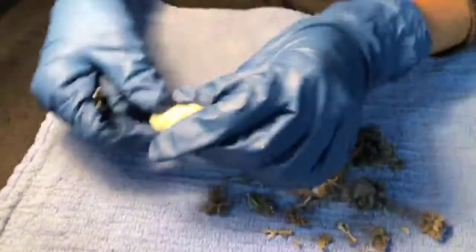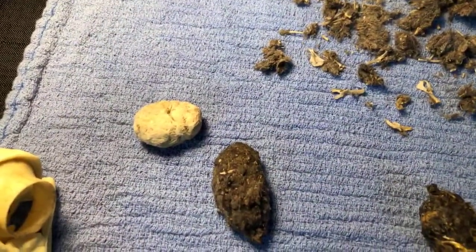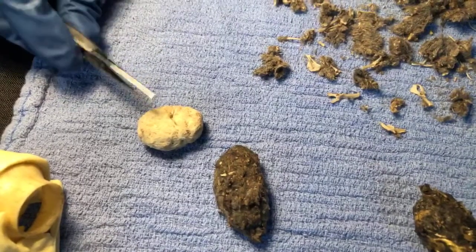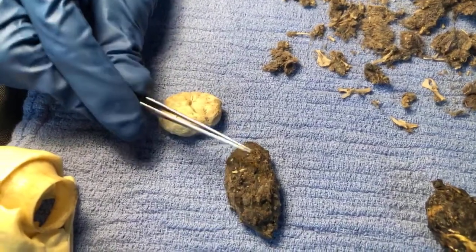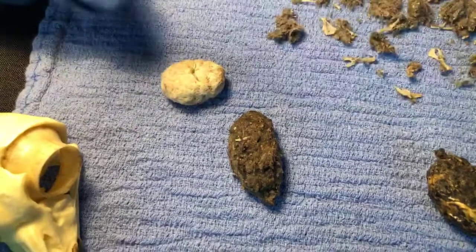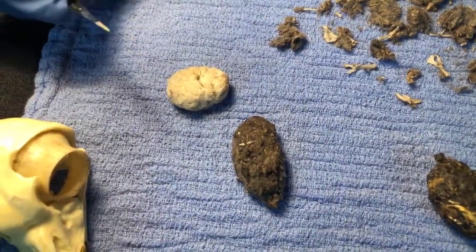Sure. So now, if we look at the one from the hawk, you'll notice the difference in color. Yeah. Okay, one is captive, one is not. Right? Because we will feed white mice to our captive raptors, and when they are going in rehab, you want to give them a darker colored mouse because there are no white mice in nature. True. Right?